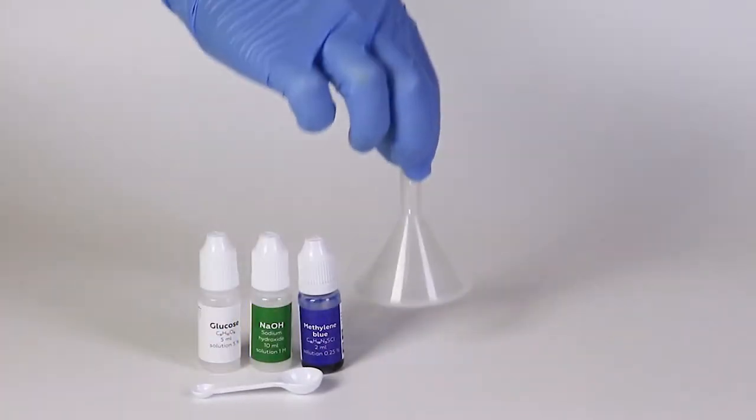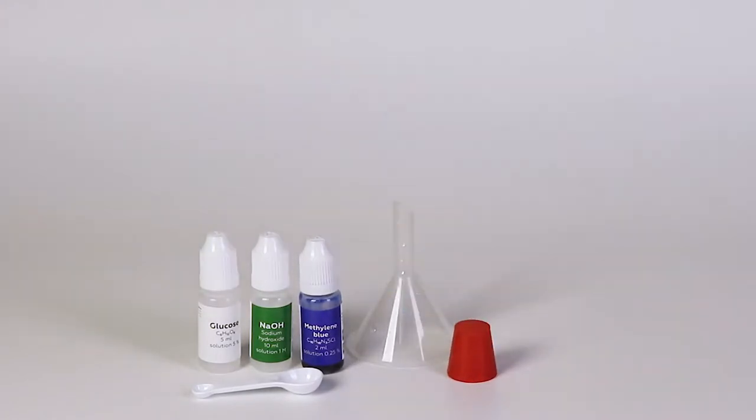From the starter kit, you will need a funnel, a rubber stopper with no holes in it, and a flask.